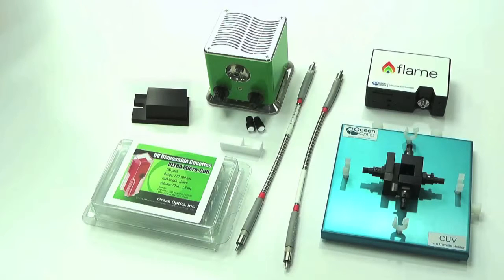The equipment used was the Flame S VIS NIR spectrometer, two premium UV VIS fibers, each 25 centimeters long with a fiber diameter of 600 microns.